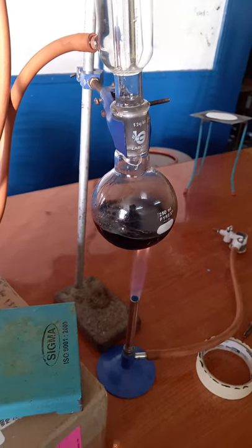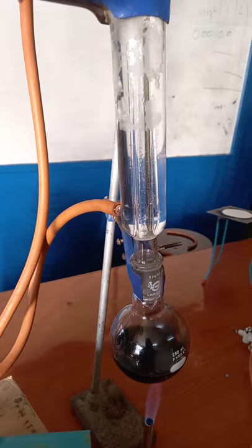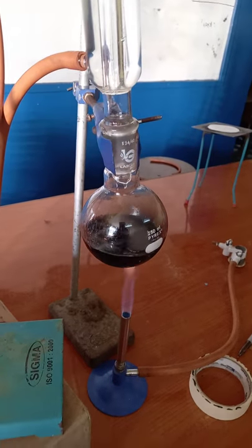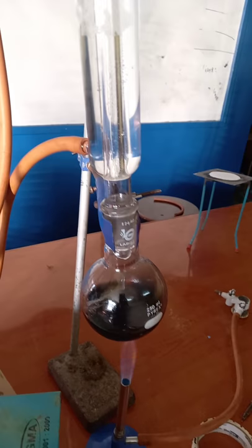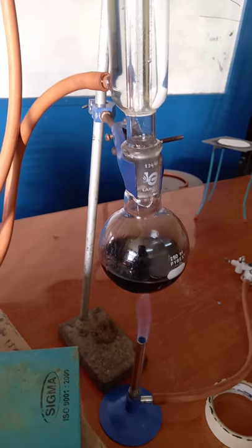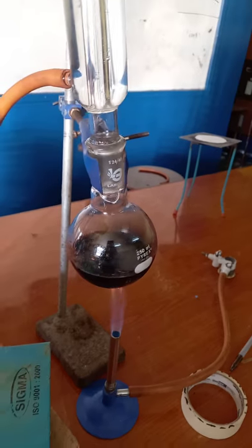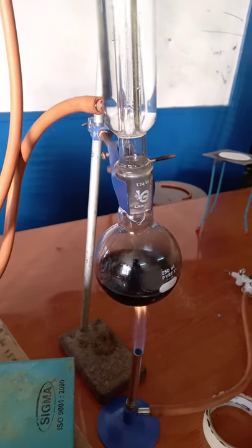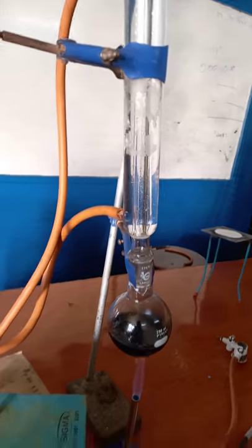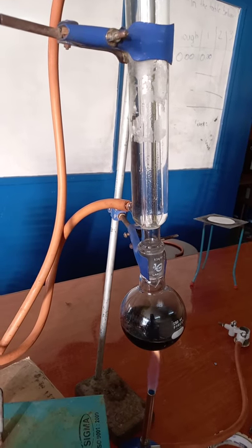If we're doing a primary alcohol, the reason why I did not do reflux for the alcohol is because we wanted the aldehyde. If we had done reflux, the aldehyde would have been converted to the carboxylic acid. That is why we did distillation — so once the aldehyde was produced, we collected it.